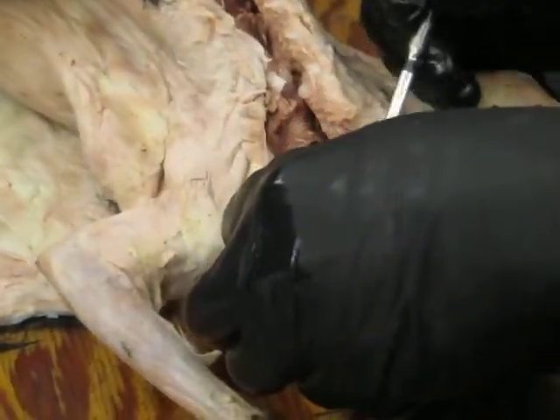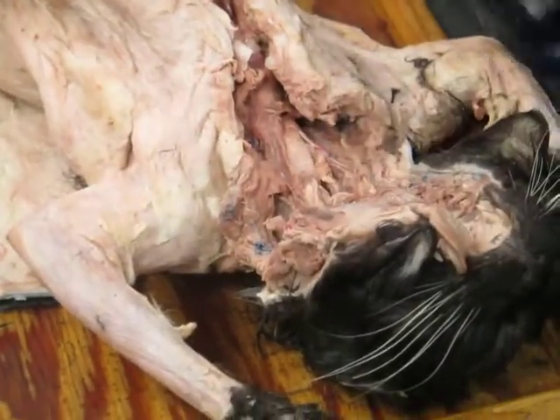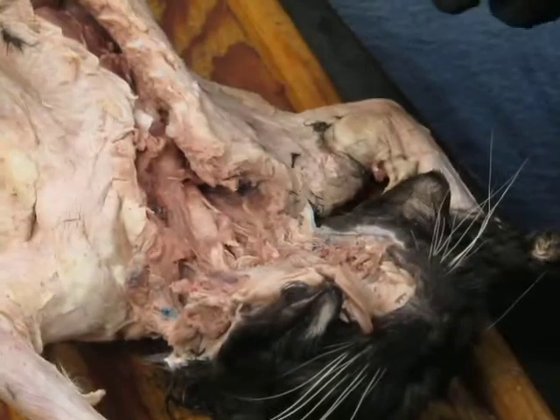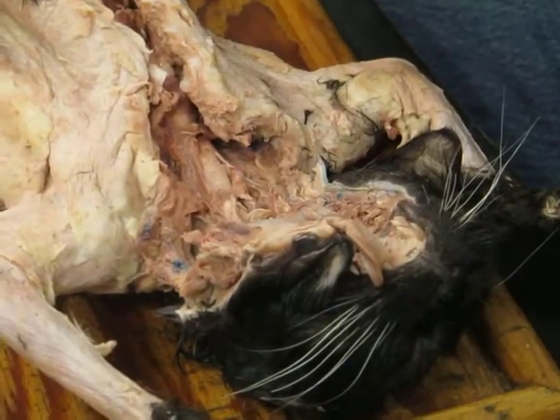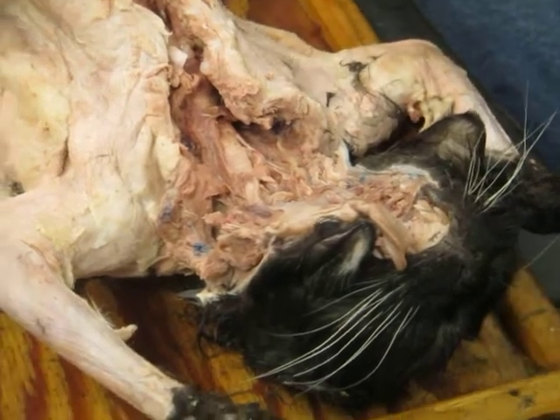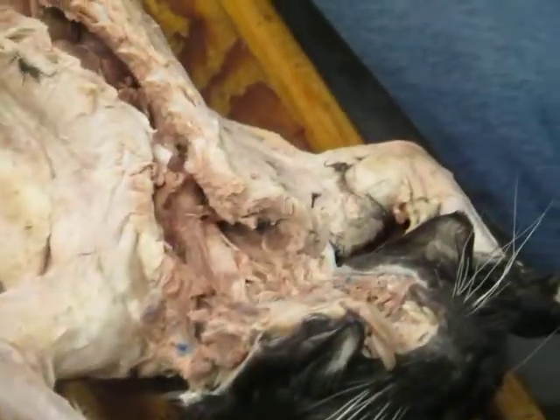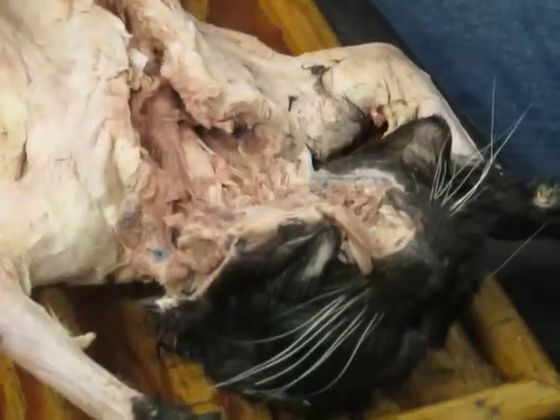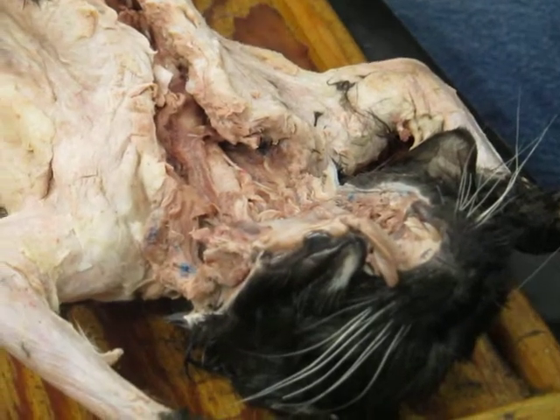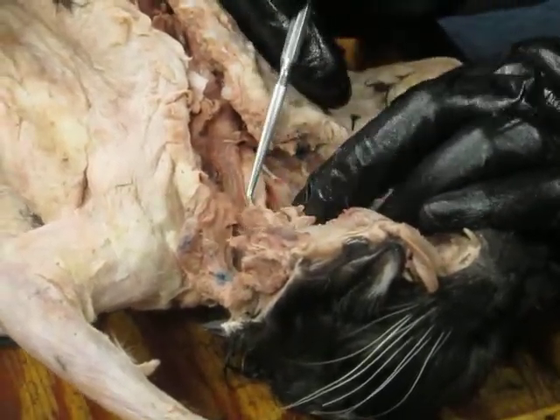And so that's the control of air going in and out of the airways, those vocal folds. And air going up passes by those vocal folds or cords, and just like if you've ever blown up a balloon and stretched it out and let it kind of fart as it's letting air out, it's basically the same thing that's going on. The air going past these stretched vocal cords makes them vibrate and makes a sound. That's how mammals have a voice. Okay.